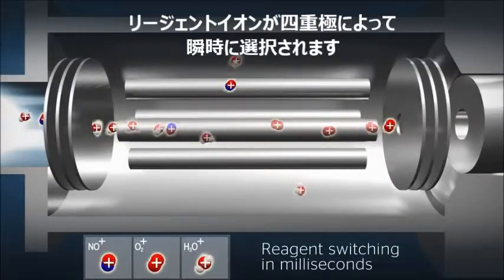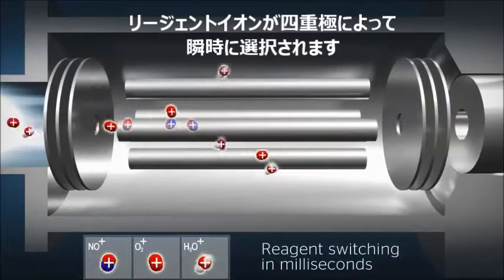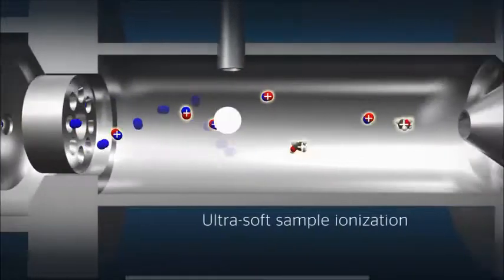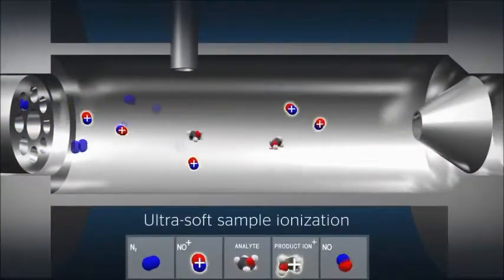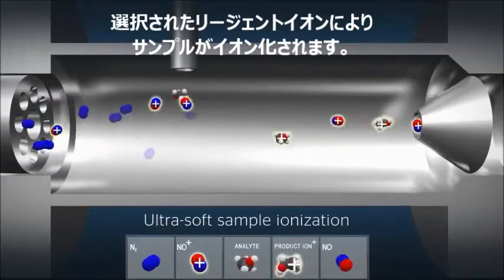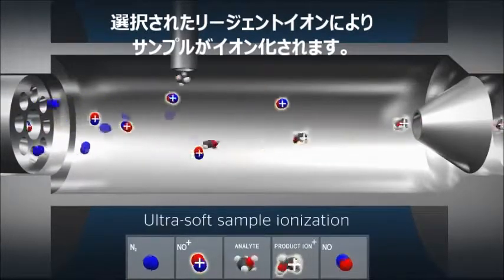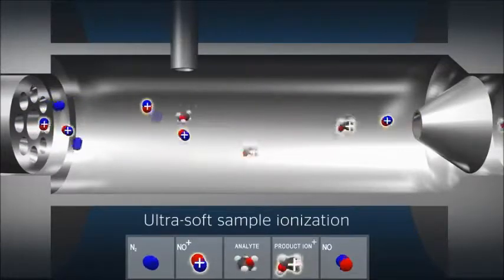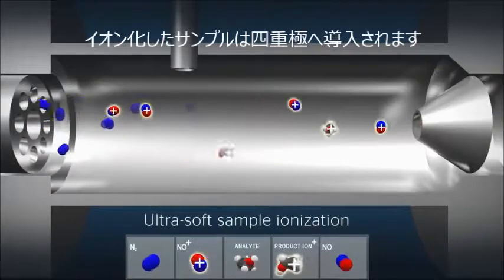Every few milliseconds, the quadrupole selects a different reagent ion to be passed into the flow tube. Entering the flow tube is a continuous stream of reagent ions and sample gas. These are conveyed down the flow tube by either a helium or nitrogen carrier gas, resulting in highly controlled chemical reactions which give stable and predictable ionization products for all compounds in the sample.